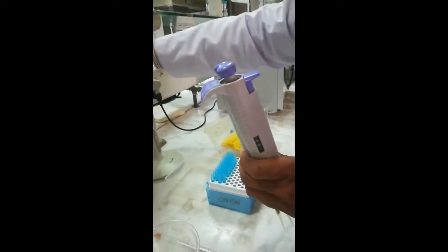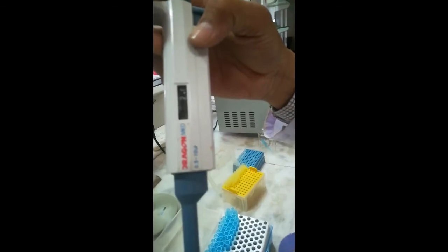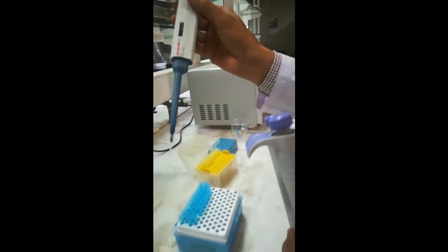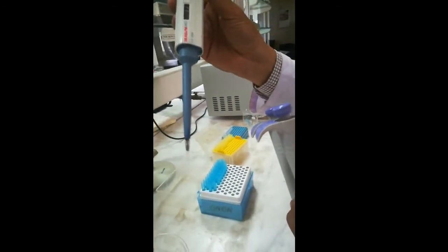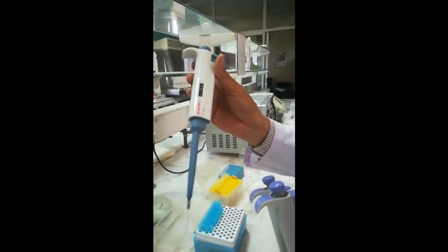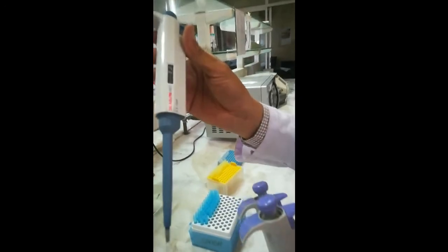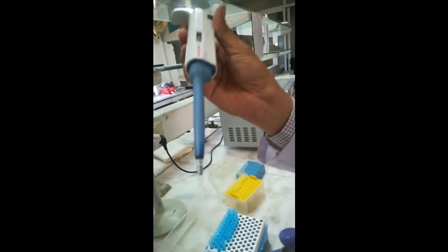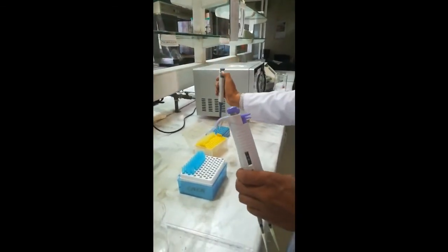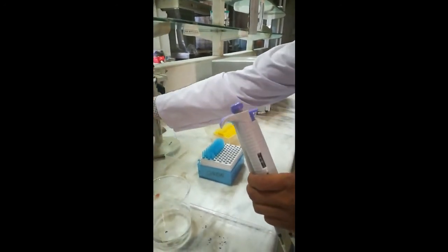Another micro pipette has a capacity of 0.5 to 10 microliter, and white tips are used with it. This handles a very minute volume. The white tips are very small, and the way of working is the same as the other micro pipettes.